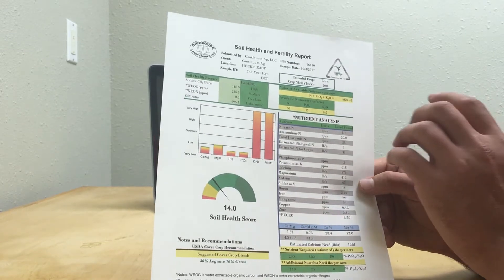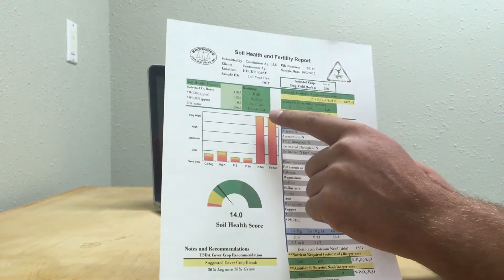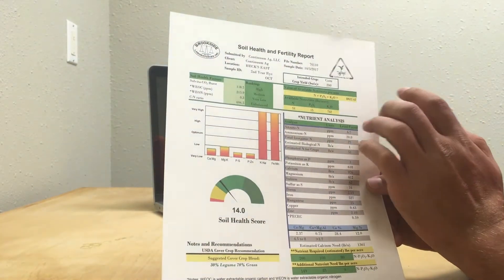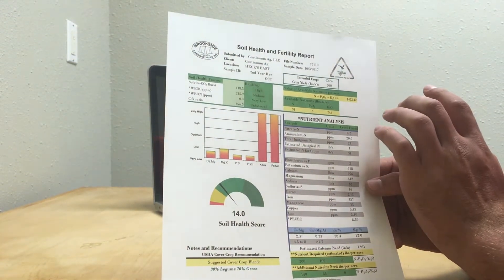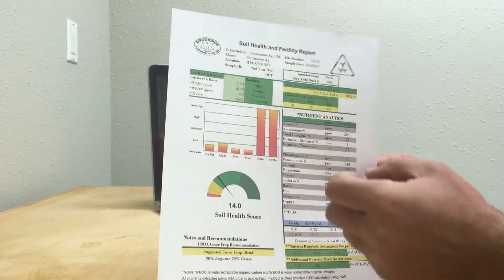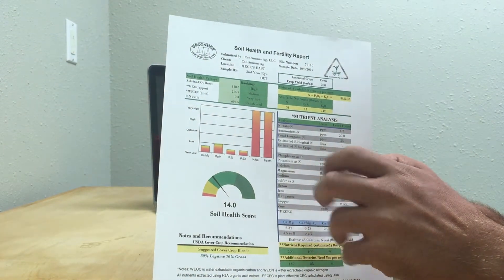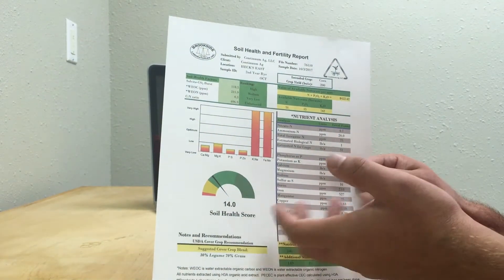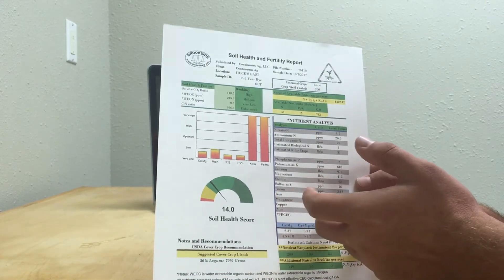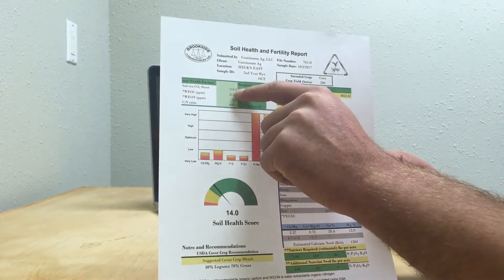The difference with the Haney test is the soil health factors shown up in the corner. Part of that is the Solvita CO2 burst. The Solvita CO2 burst is essentially a number representative of the amount of biology that is active in the soil. They take a set amount of soil, dry it down, re-wet it with a set amount of water, and collect the CO2 emitted over a 24-hour period. The more CO2 emitted, the more active the soil is and the more biology that's in the soil. That's given a ranking at the very top.